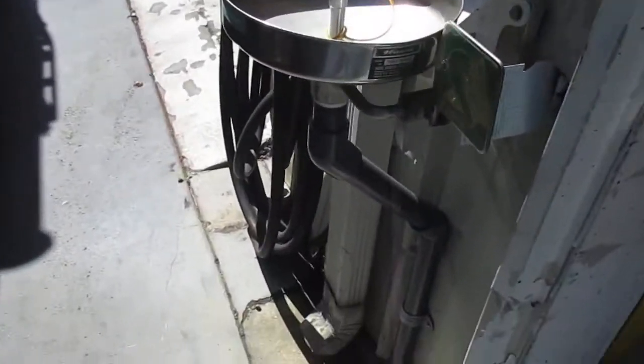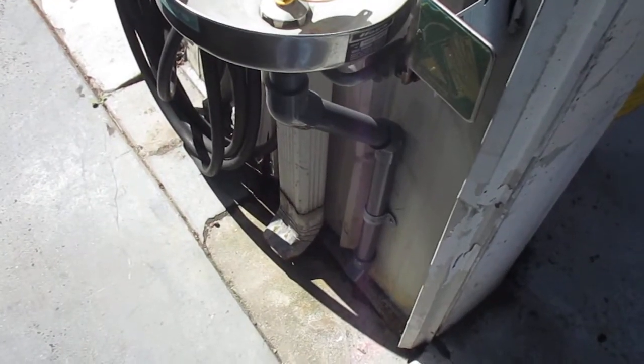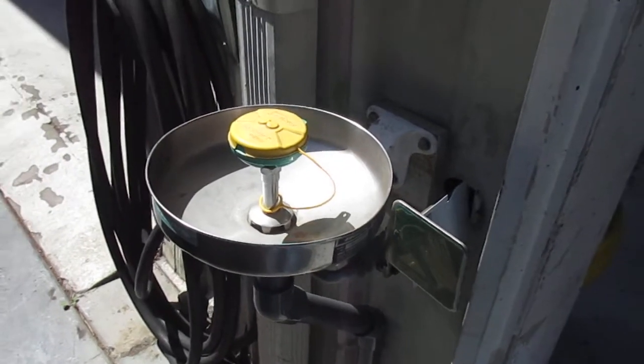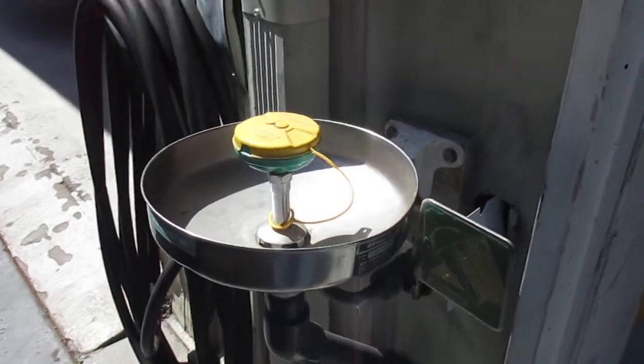Priscilla, she recently broke the drain, and Doug the plumber fixed it for us. I told him that the pressure wasn't very good, it's kind of limp, just wasn't really doing much. And anyway, check this out, he really hooked it up here.